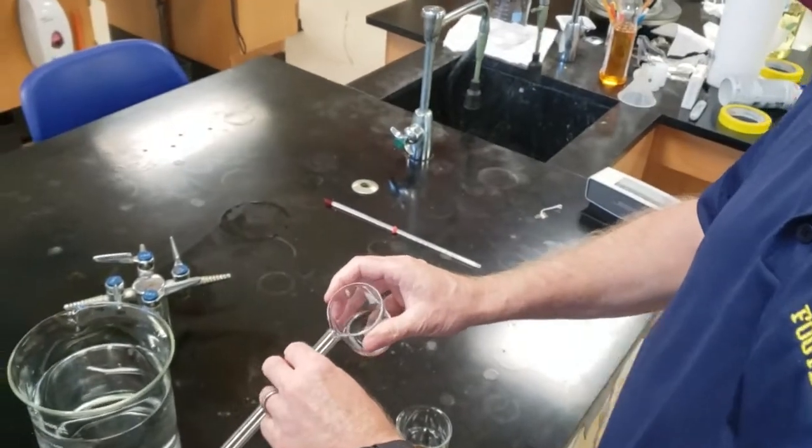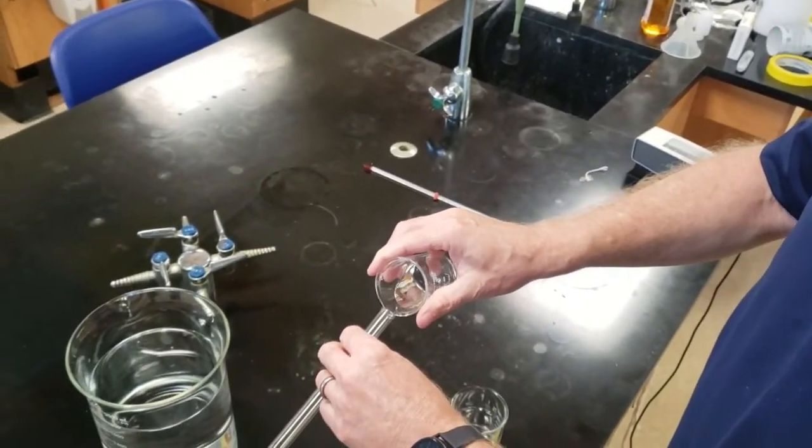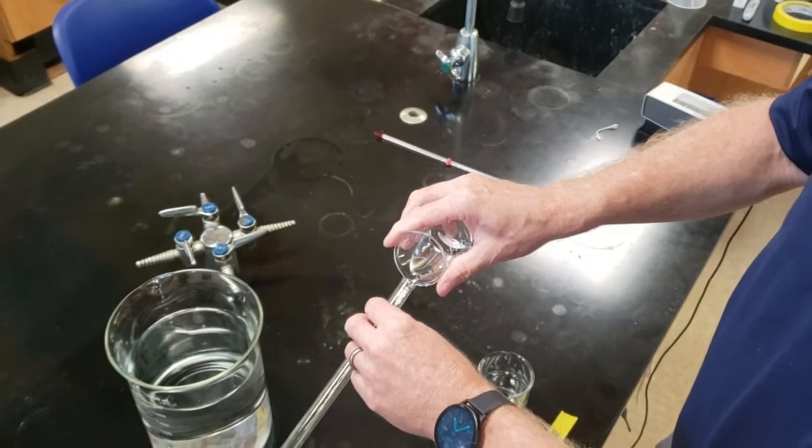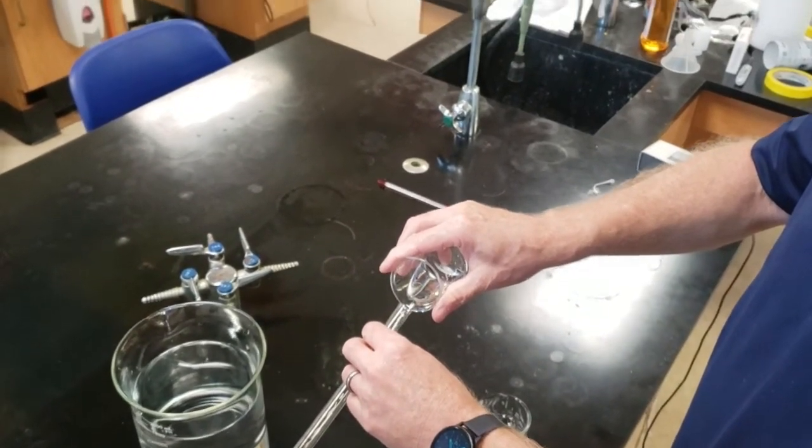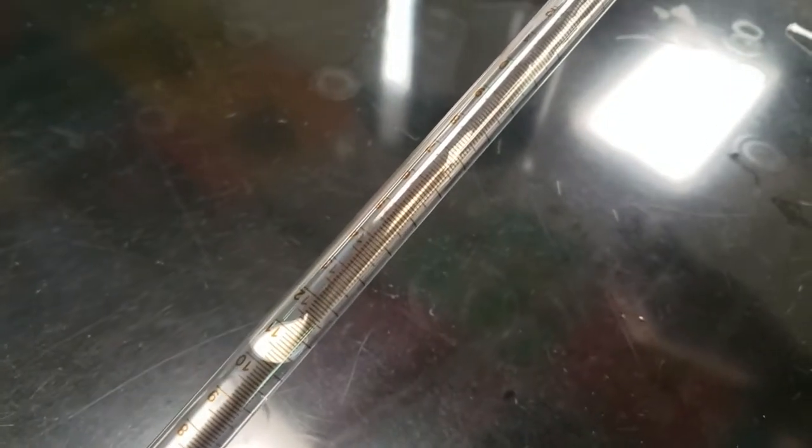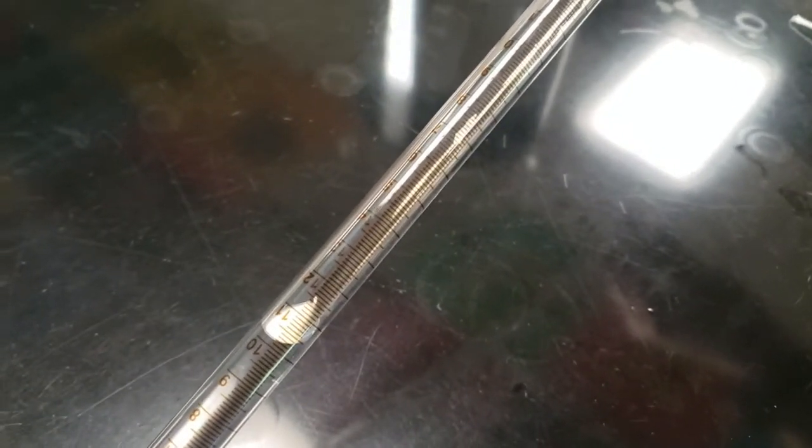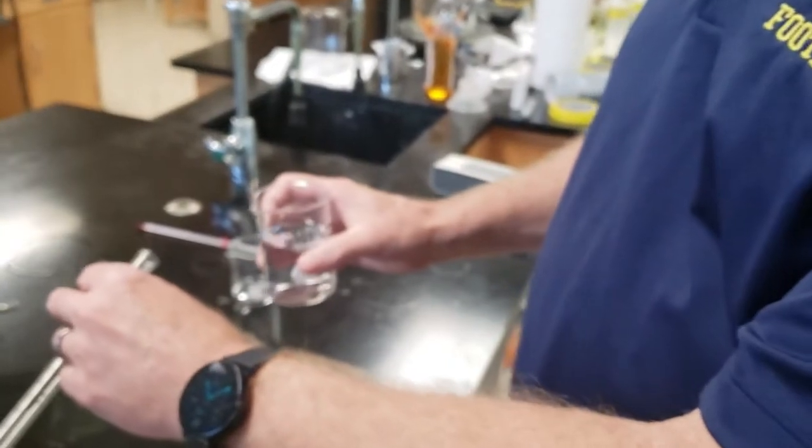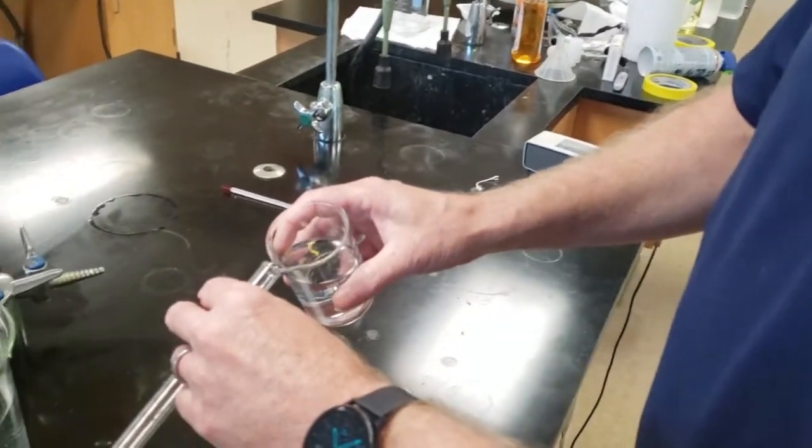First grab the hydrochloric acid, and we're going to pour it in. Notice I have it tilted. We're going to pour it in until it's about eight or 10 milliliters of this very concentrated hydrochloric acid. The acid is probably about a three or four molar. That's very concentrated. I got just above 10. It's not a precise measurement. We're using a large excess of acid.